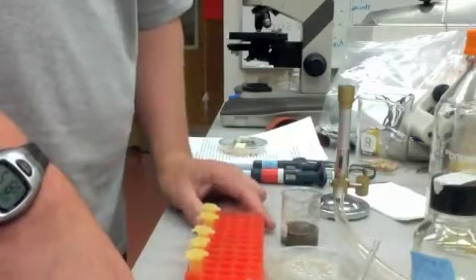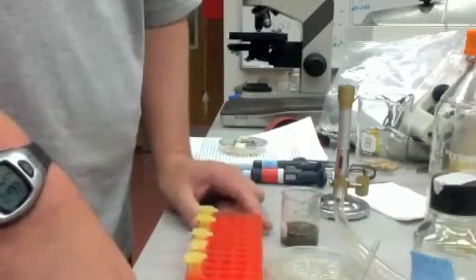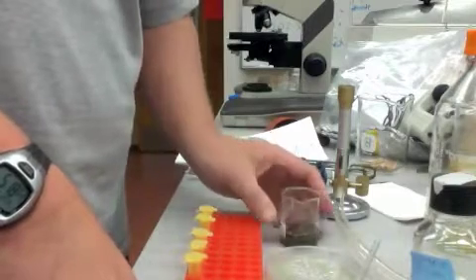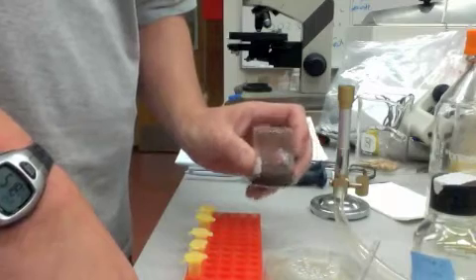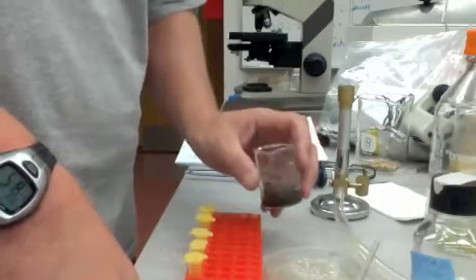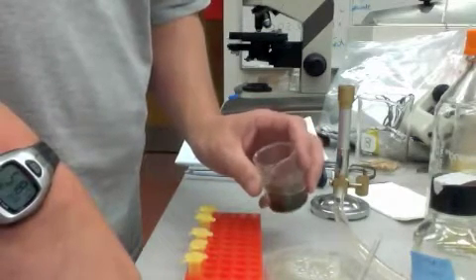Okay, so you're going to be doing some dilutions today and try to do some enumerations. To do the enumeration of, say, a soil sample like this, you can't plate this directly and hope to count things because there will probably be too many cells, too many colonies in a couple days.